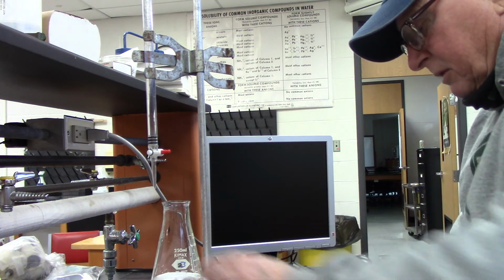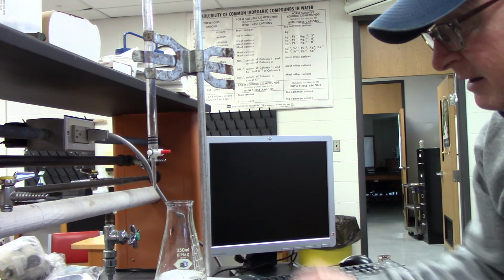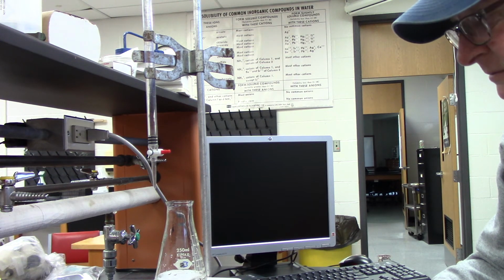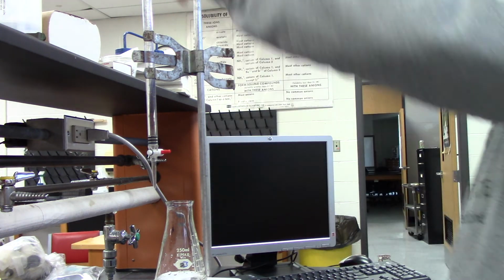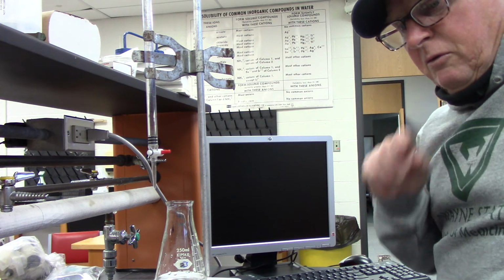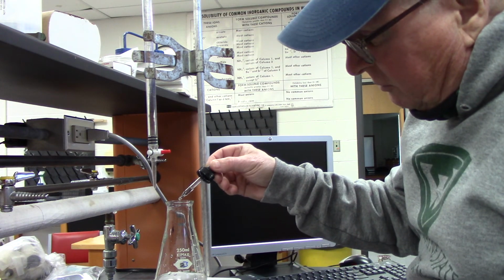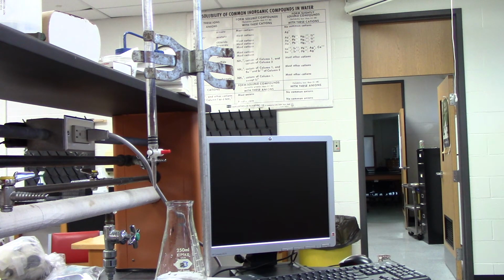Hopefully it's going to be good to do that. If it doesn't, then I miscalculated. All right. So I imagine it says 21 now. If I get around 45, that's between 40 and 50. It's a little bit dicey, but I think I'll be okay. So 1, 2, 3. All right.